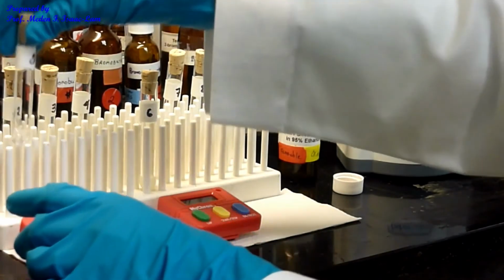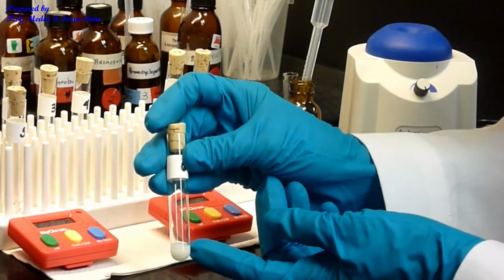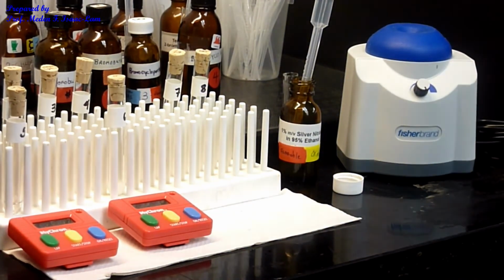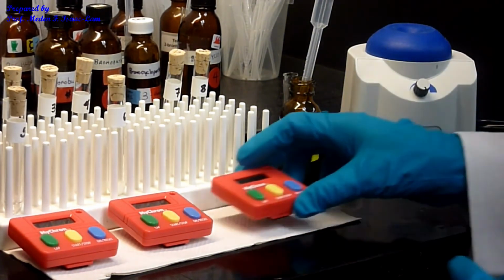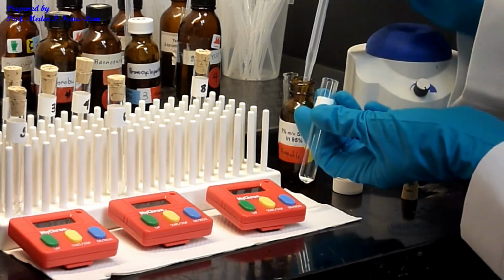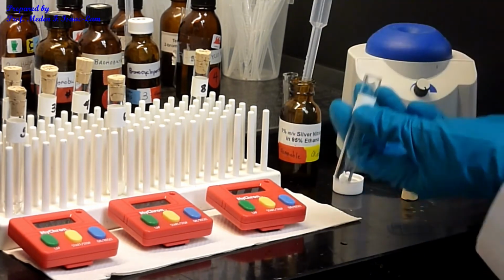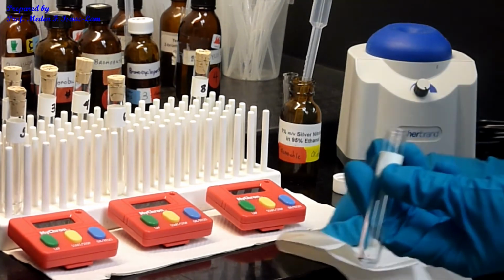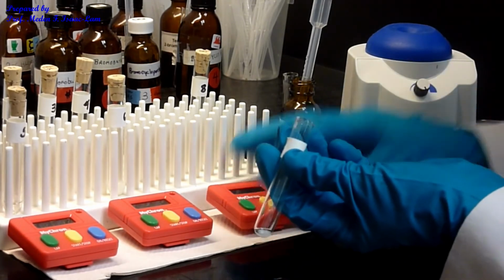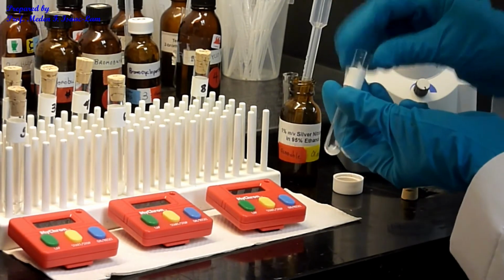So number 5, clear, nothing. So this one started to precipitate out. Alright? Okay? And then I'm gonna do 7. Okay? So 7, let's see if there's some instant precipitation when I put a drop. So I see, okay? So I set it. So in like less than a second, I see a precipitation, but let's see if I put more.